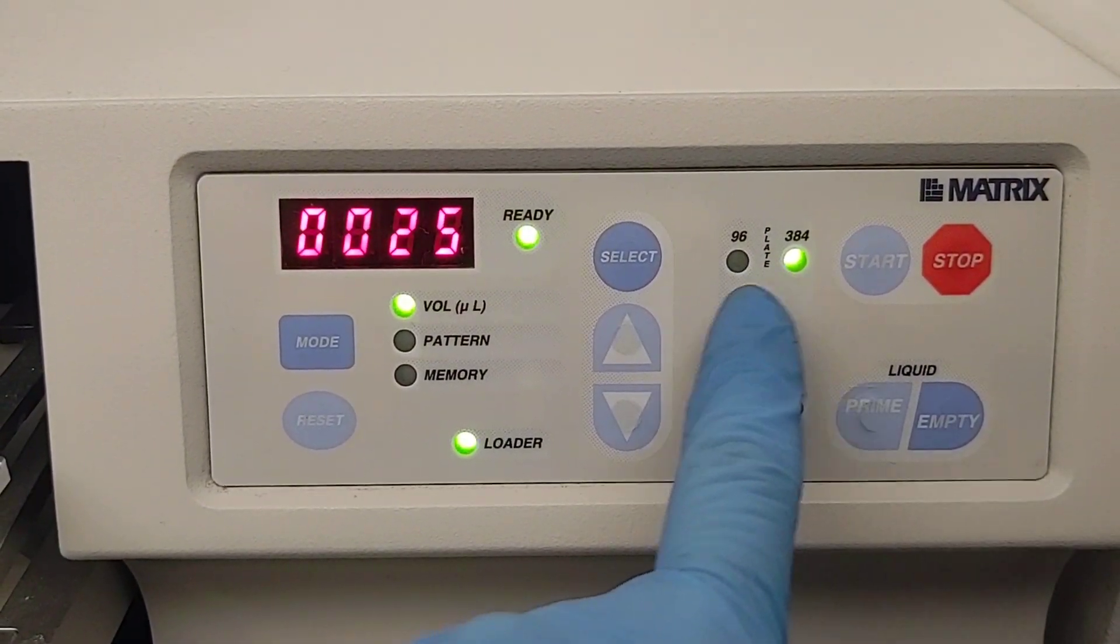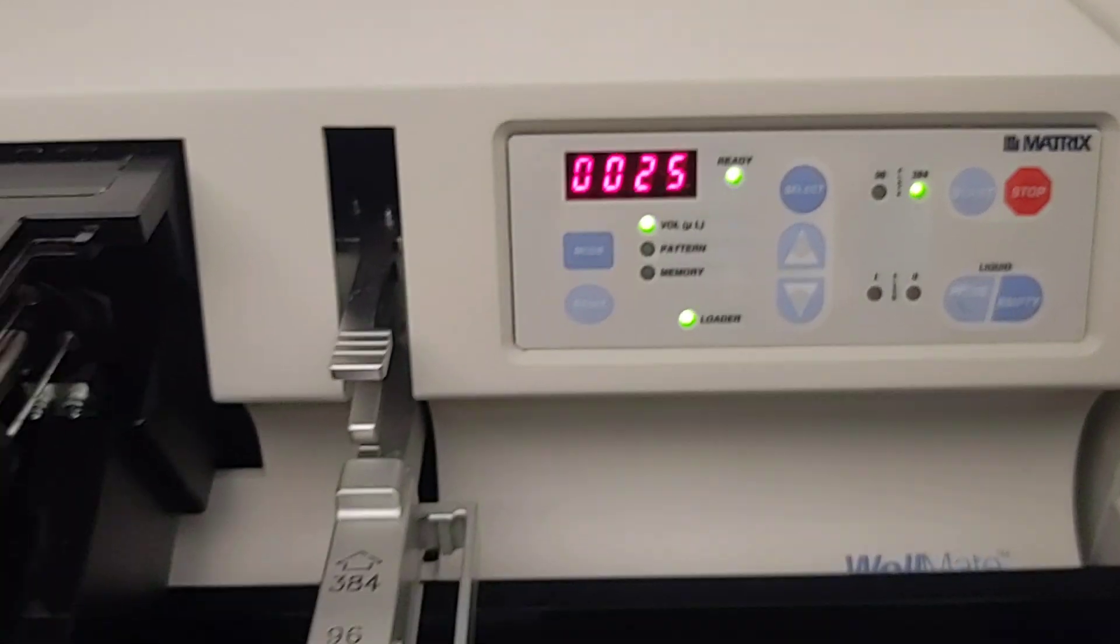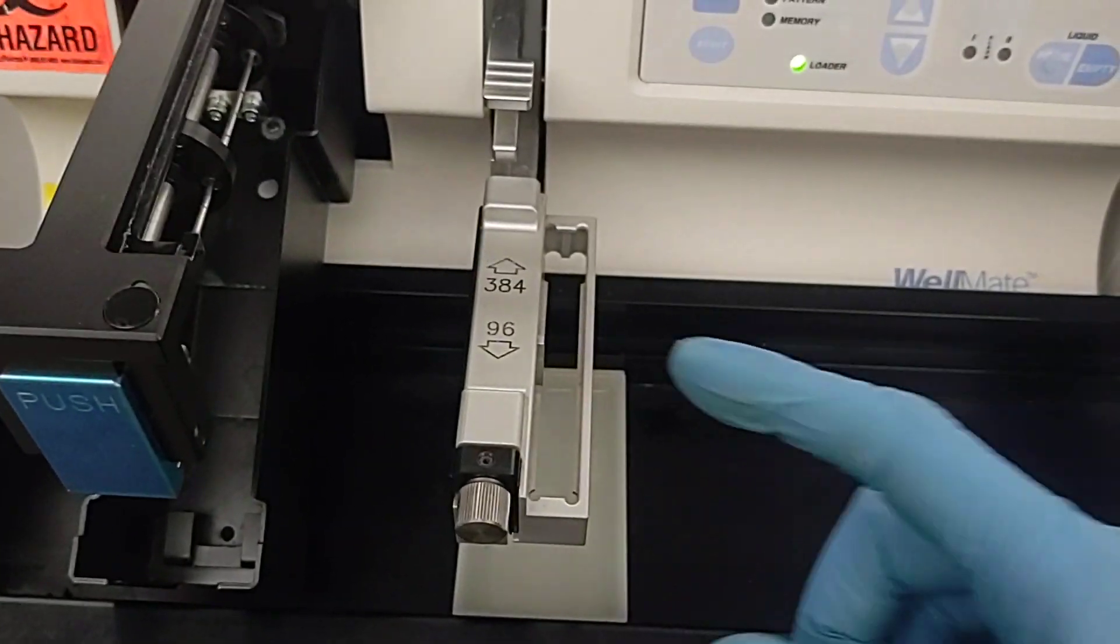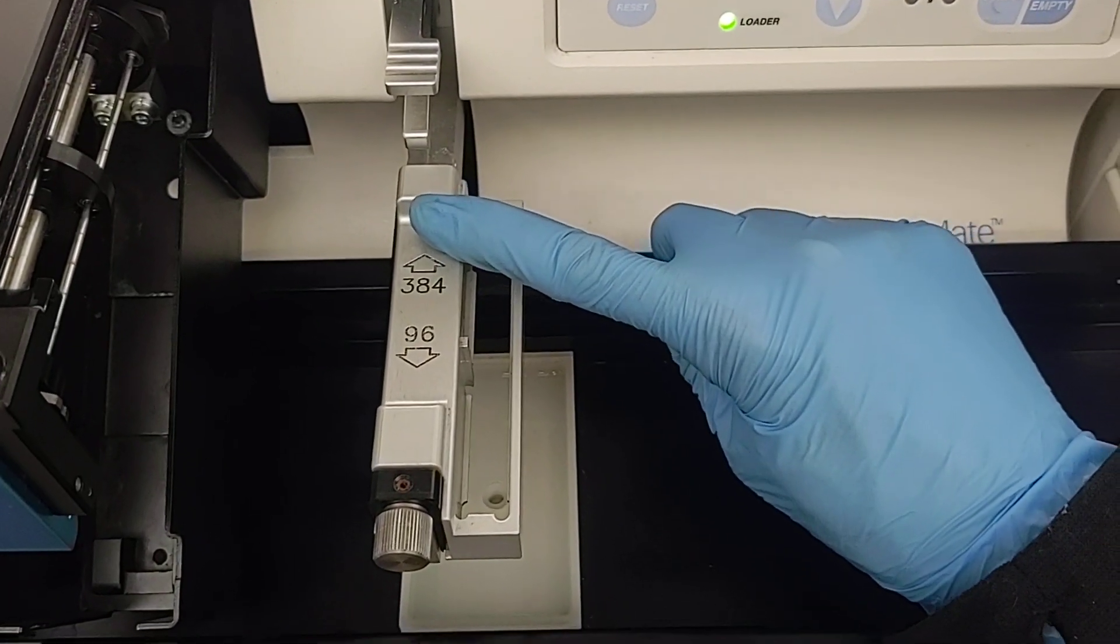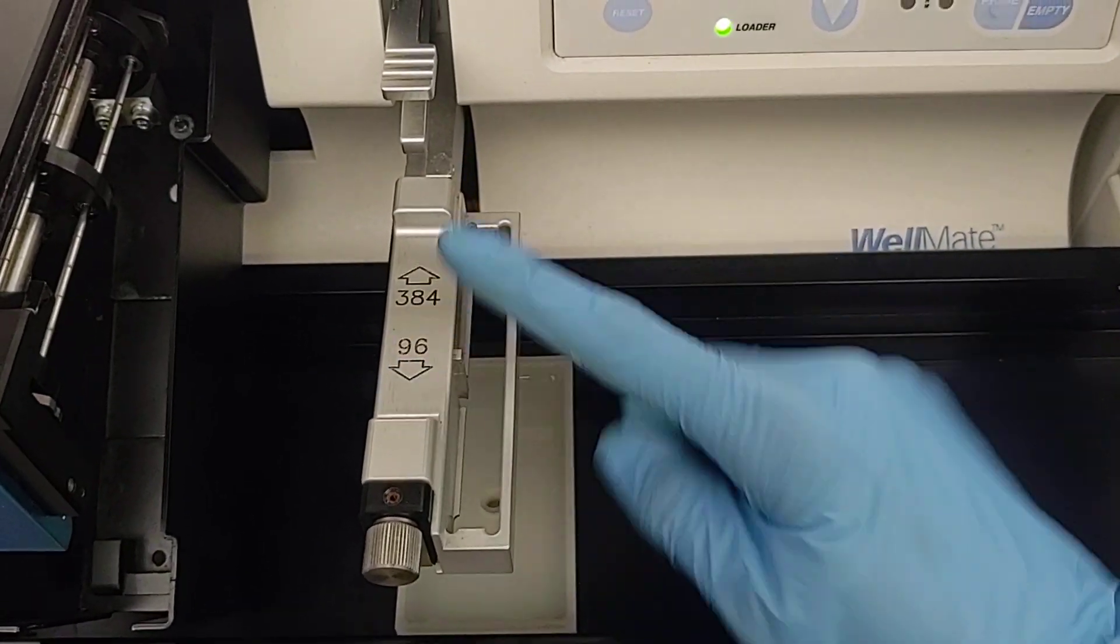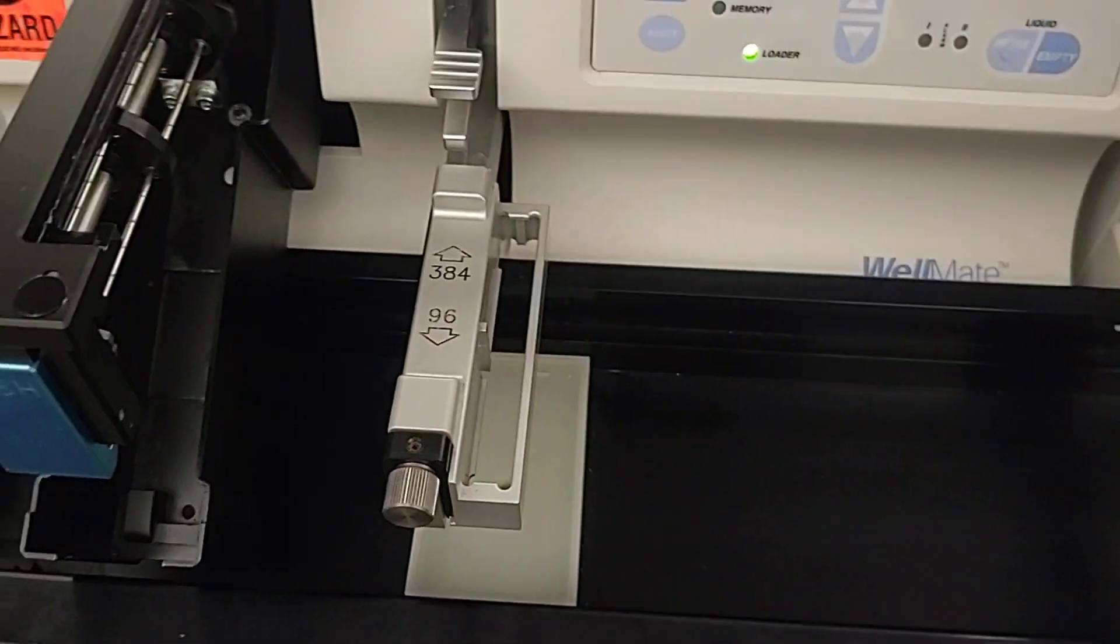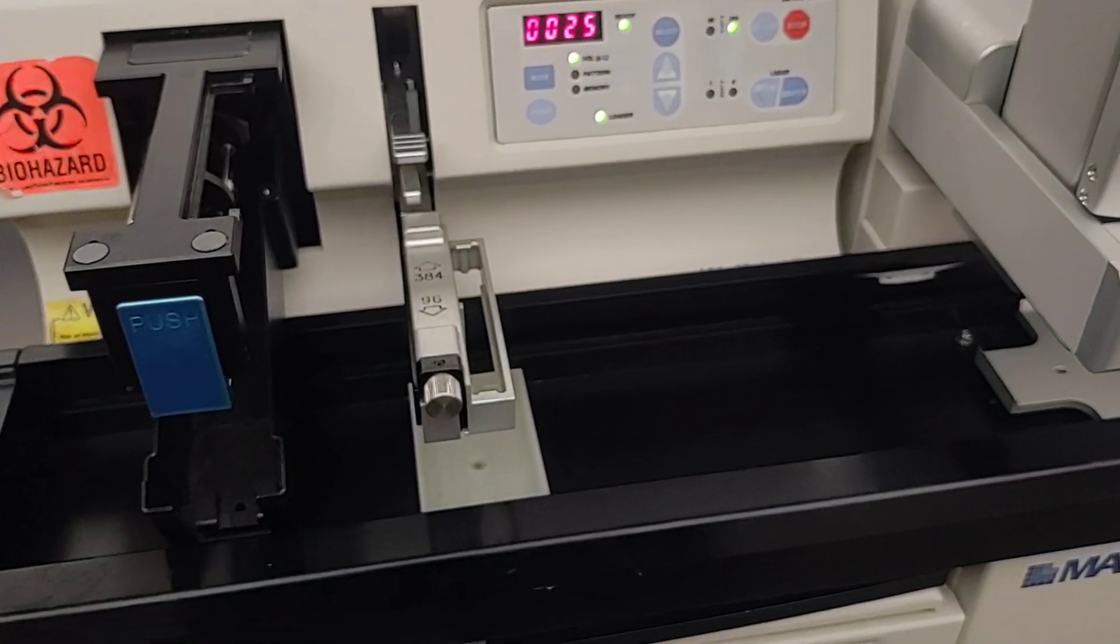Make sure it's set to the plate format that you want. And over here there's a device that adjusts for the different positioning of the wells in 96 or 384 well plates. So put that appropriately, we're doing 384 well plate.